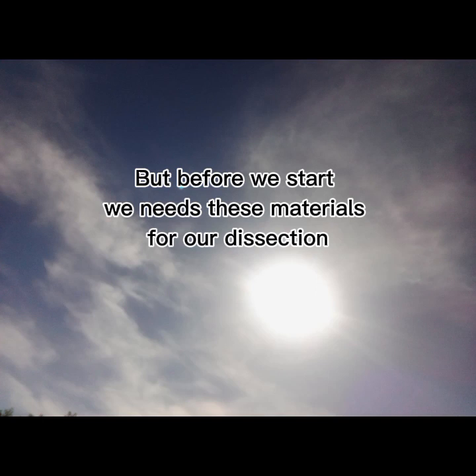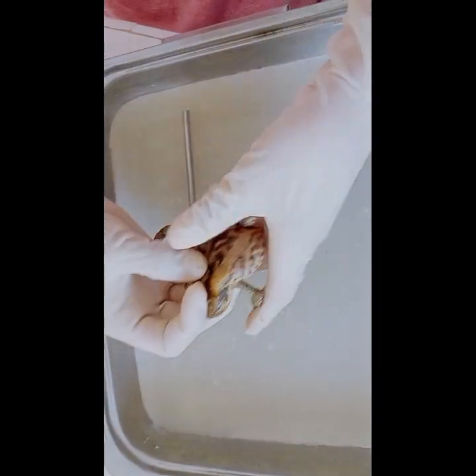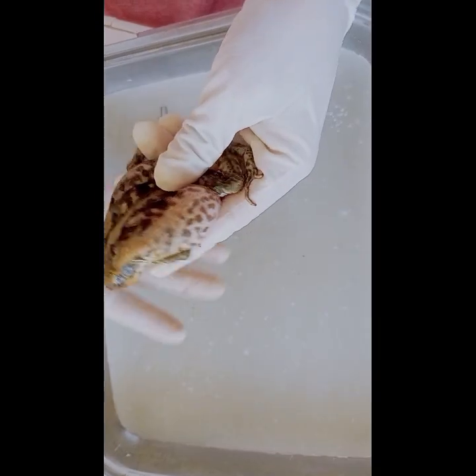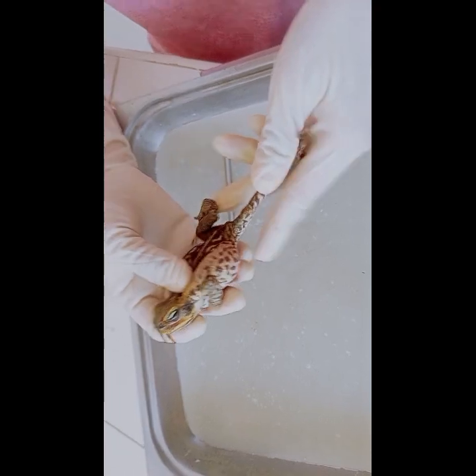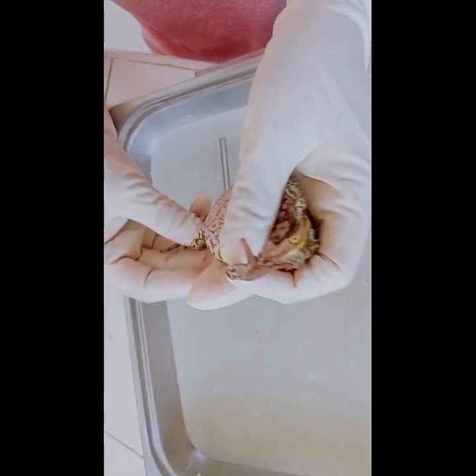But before we start, we need these materials for our dissection: the dissection tray and dissecting kit, and also the frog. Now that we have these materials, we'll examine the parts of the frog. First, we'll examine the hind legs of the frog. So, as you can see, these are the hind legs.